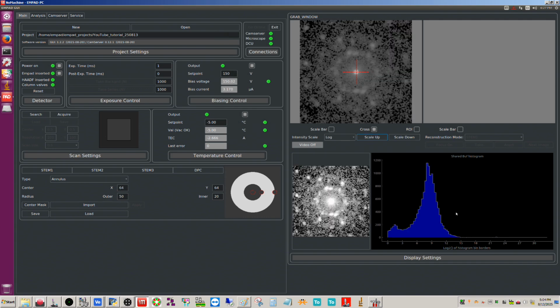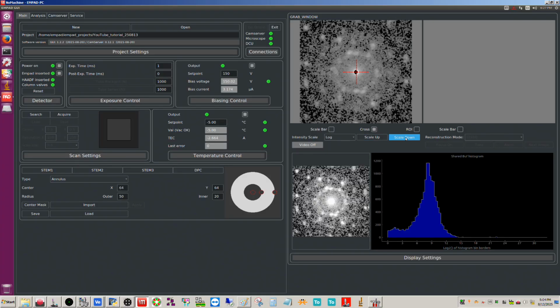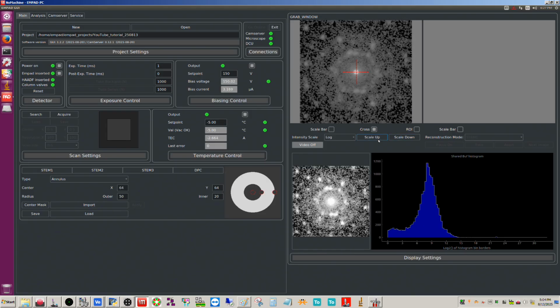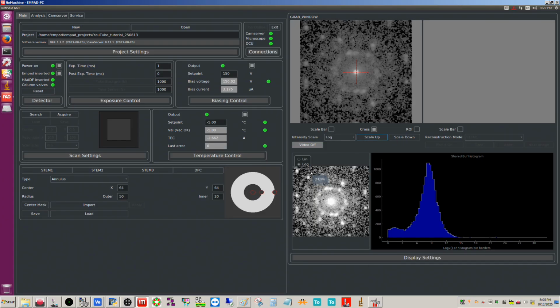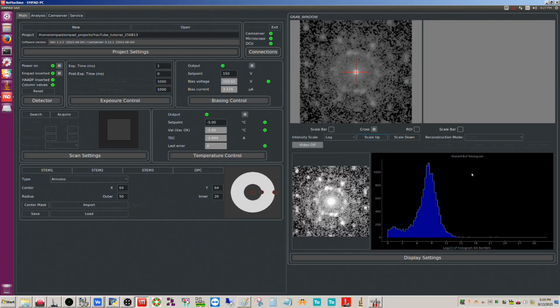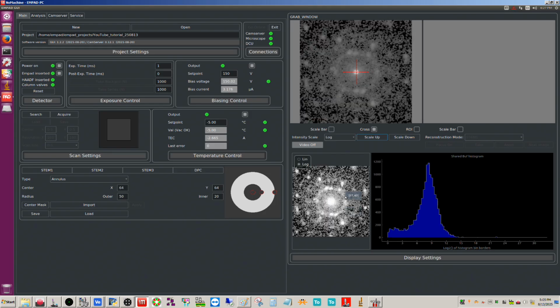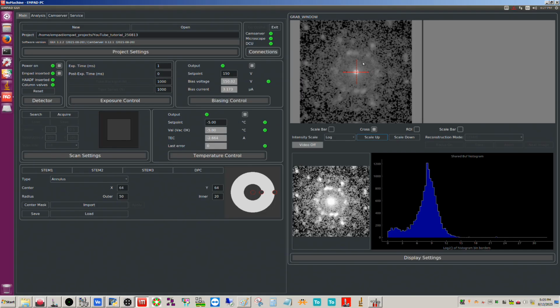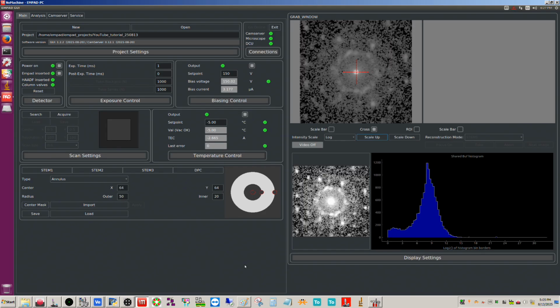As for the histogram, someone asked if this can be useful for determining saturation, and really it doesn't help much in my opinion. Like you can see I'm changing this, it's not doing anything to the histogram. You have to rely a little bit more on just knowing your semi-angle of convergence and your probe current for that. Okay, and this is what we're seeing here as far as the histogram. Now when we actually export the patterns, they're not going to look like this. This is just a digital enhancement that we're seeing now. But if you take a look at the pattern here, what I want you to see, because right now we're not scanning the beam at all, but if you look at the pattern here, let me take a print screen really quick.